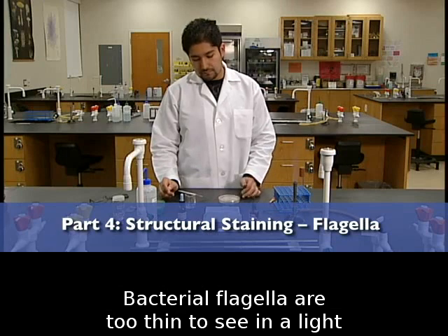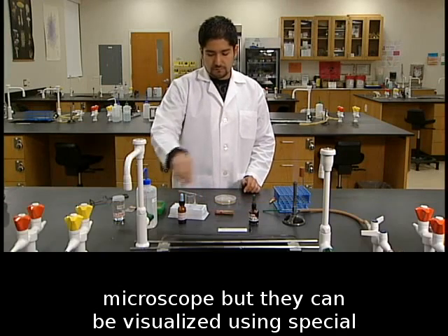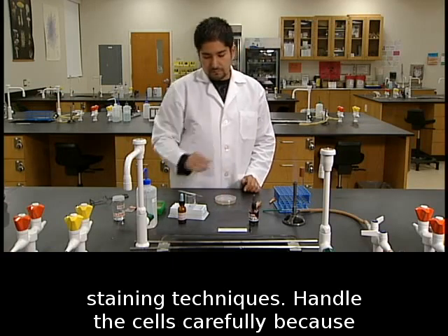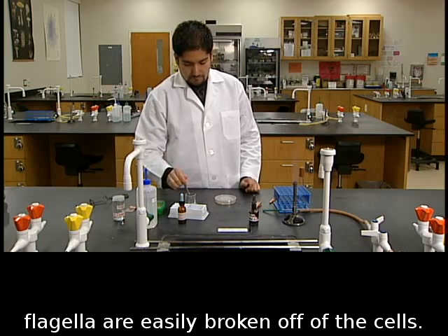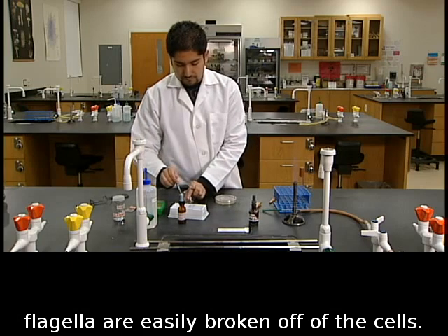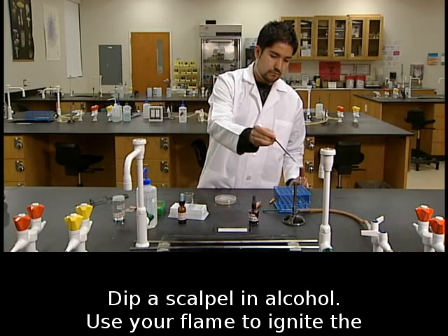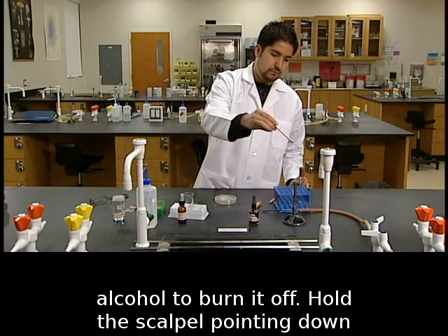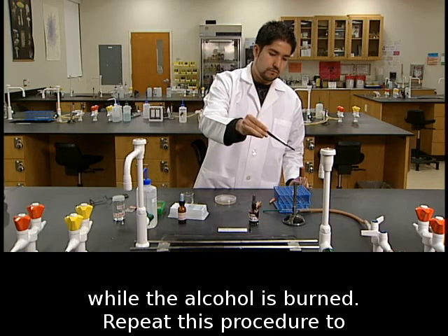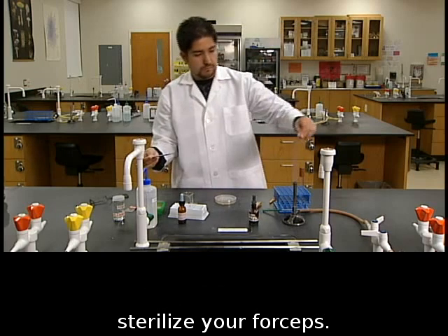Bacterial flagella are too thin to see in a light microscope, but they can be visualized using special staining techniques. Handle the cells carefully because flagella are easily broken off of the cells. Dip a scalpel in alcohol. Use your flame to ignite the alcohol to burn it off. Hold the scalpel pointing down while the alcohol is burned. Repeat this procedure to sterilize your forceps.